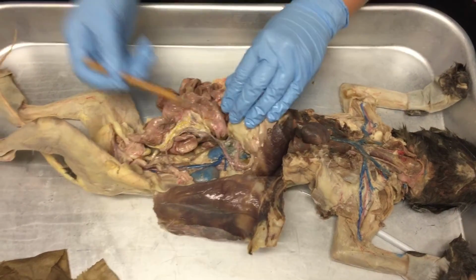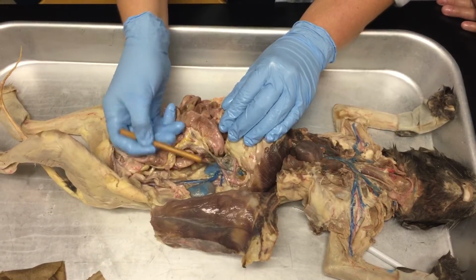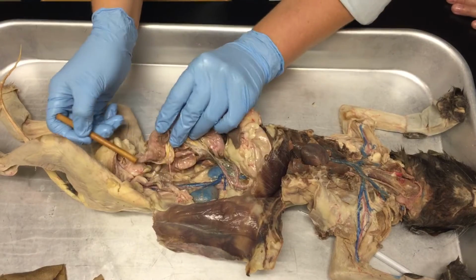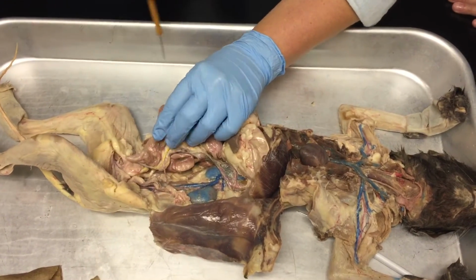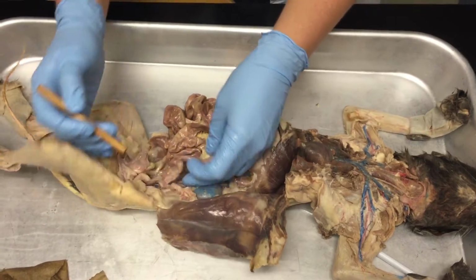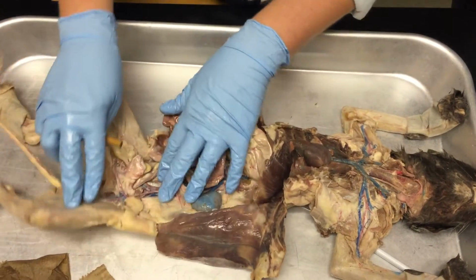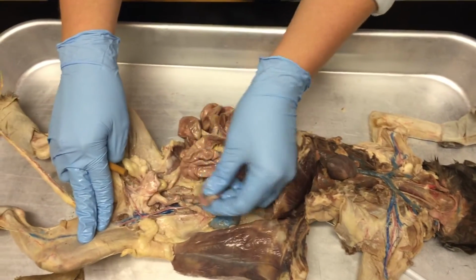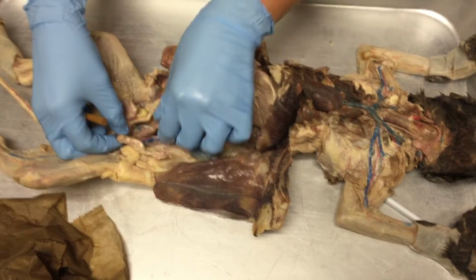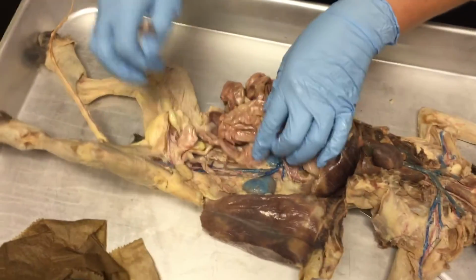Okay? So CSI. Celiac trunk going to the stomach, superior mesenteric going to the small intestines, inferior mesenteric going to the large intestines. Okay? What I did was I took the large intestine and I cut it away deep inside so that we could see all of these arteries and veins down here, right? So that's why this is detached. But normally it would be down in there, okay? But I detached it so we could see all of this stuff.